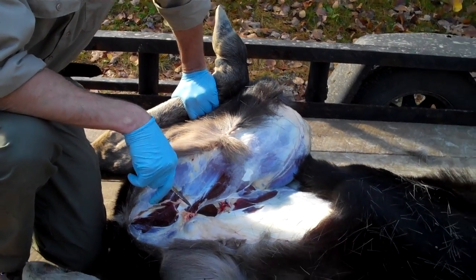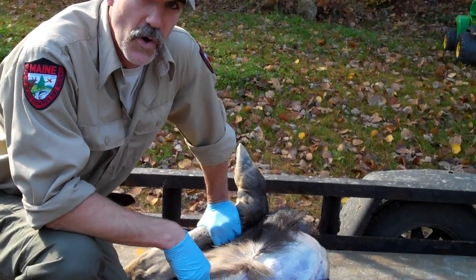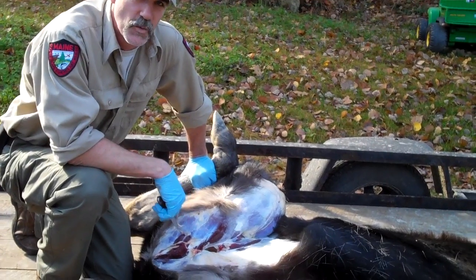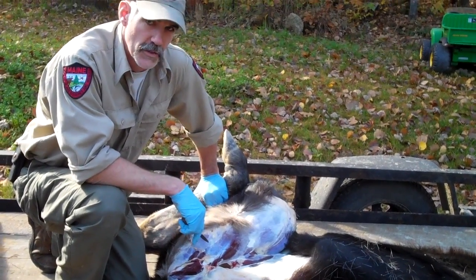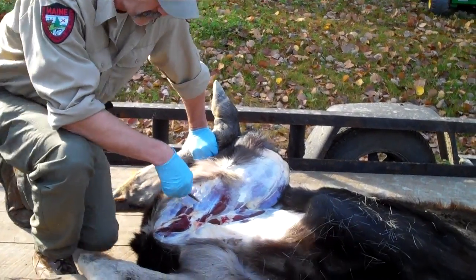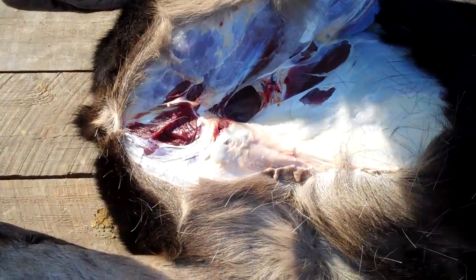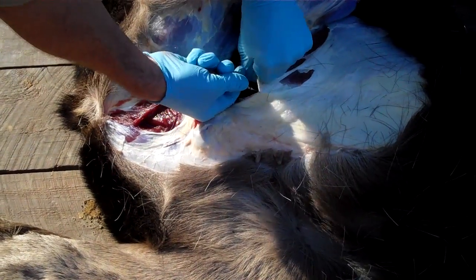We got this moose down, we have her on her back, and we've started to open her up. During this process we want to make sure that we can locate the reproductive tract and remove the ovaries. You can look right now, just as I started to cut her open, we can look down into the guts, into the abdomen, and I'm going to cut back on this and expose more of this area.